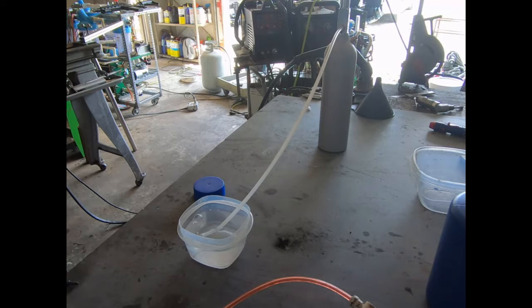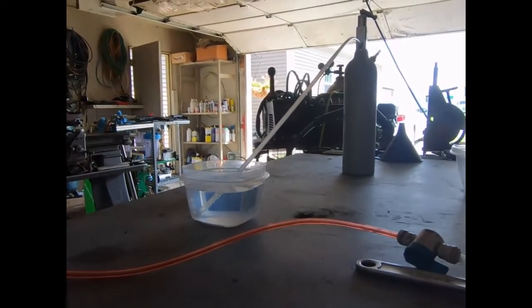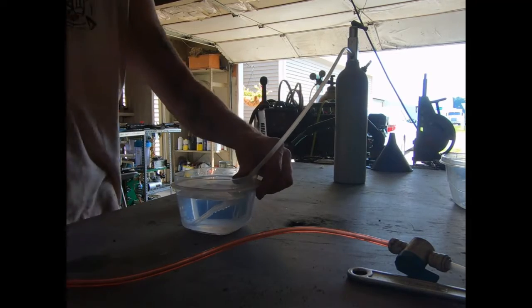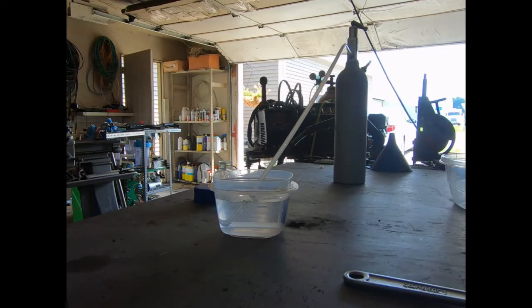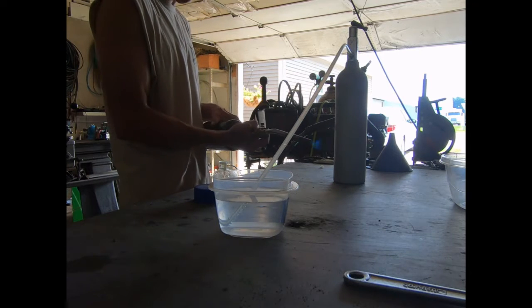Holy cow, is that air bubbles just from the heat expanding? Did you guys see that? If I can get you a better view of this — that may just be air. Getting the air hotter so it's going to expand. So don't get too excited just yet. But if it keeps happening, we know we can't infinitely expand the air.